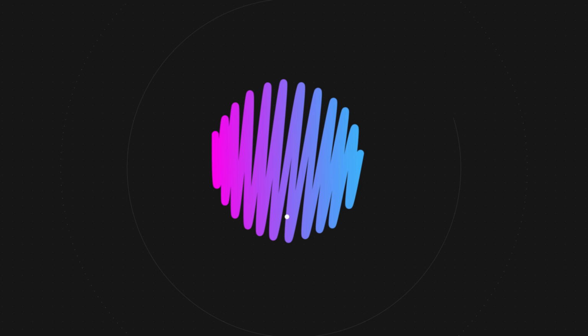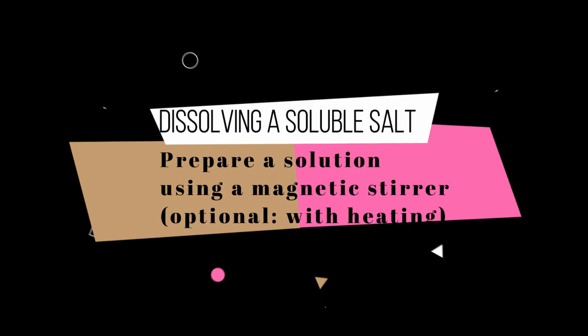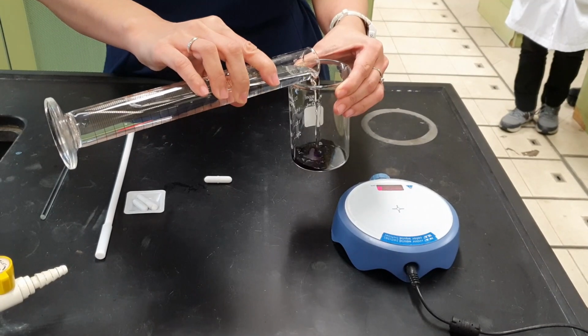One is for dissolving soluble salts, and the other technique is for dissolving salts which clump together or are not very soluble. Let's start with the first video and we will show you how to prepare standard solution using a soluble salt. Firstly, weigh the soluble solid in the beaker.